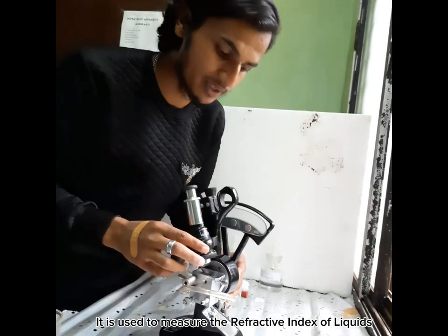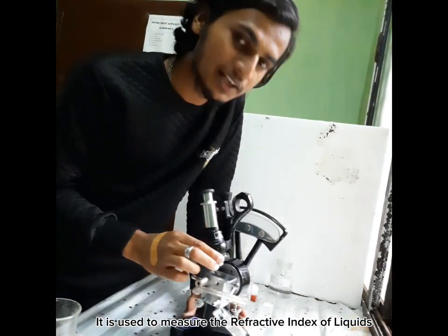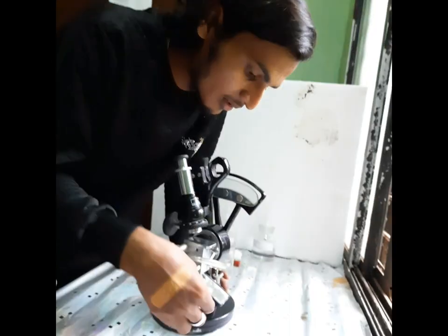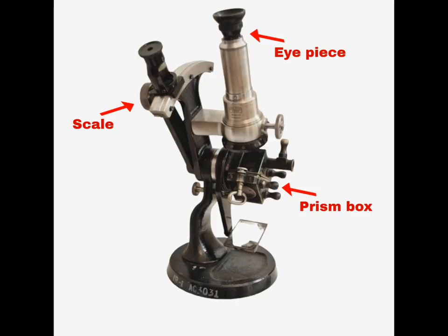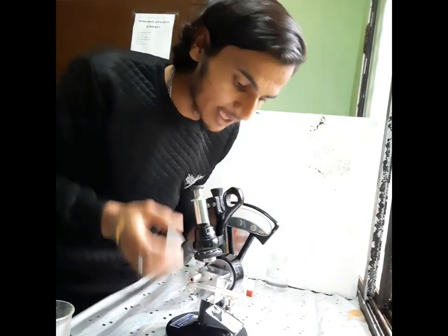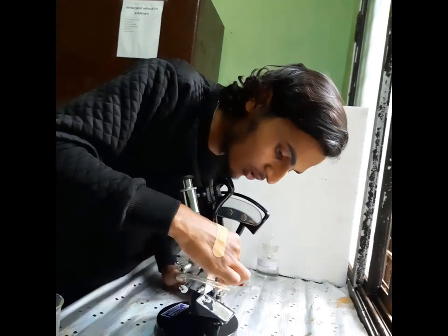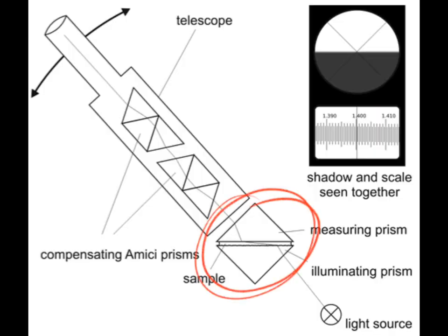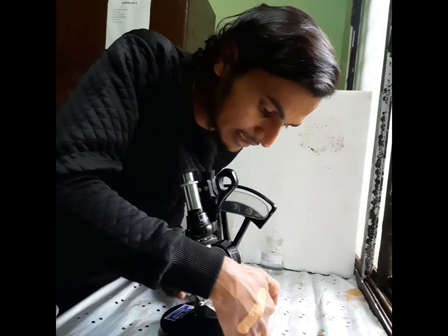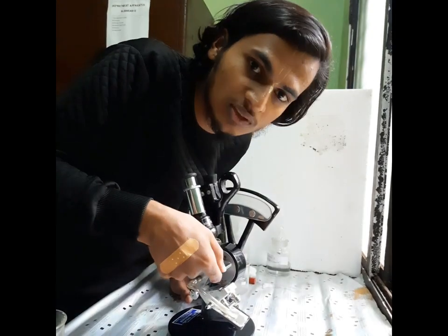This is the Abbe refractometer. We use this instrument to calculate the refractive index of liquid. The parts of this Abbe refractometer are the mirror, two eyepieces, and the prism box. We can open the prism box by this knob. It has got two prisms — one is rough, which helps to get light inside, and the other is a smooth prism.